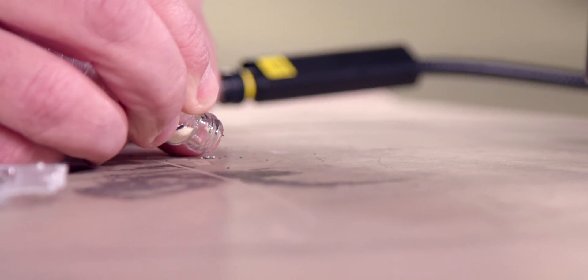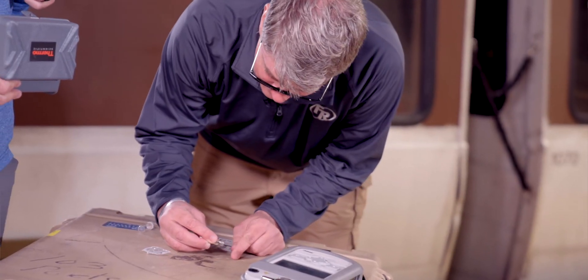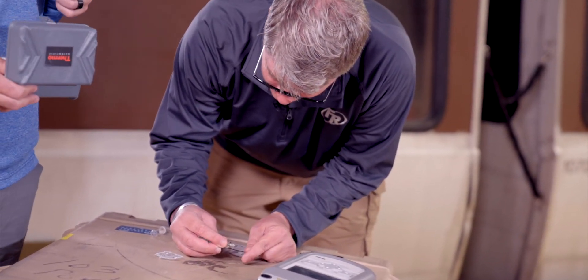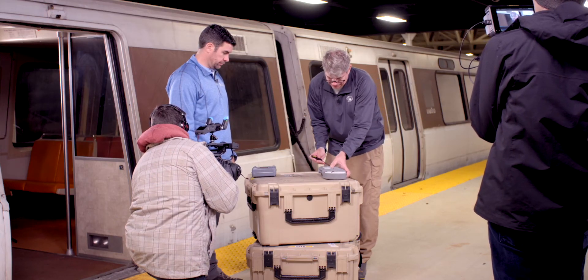If we go to a vial first, then you have the potential to cause an explosion in that vial and you fragment that vial. So you should never go to vial first. Your first scan of any unknown solid or powder should be in point-and-shoot mode first, to basically determine if it's explosive or not. If you scan it multiple times and it doesn't detonate, then you can go ahead and transfer it to a vial and try it that way. But still use only a small amount in the vial.